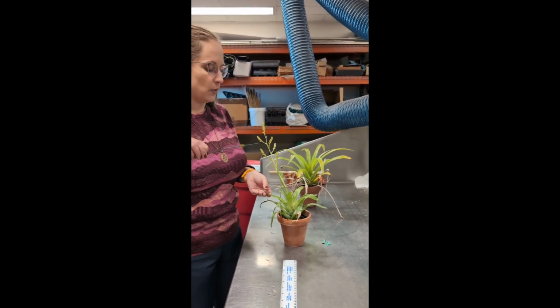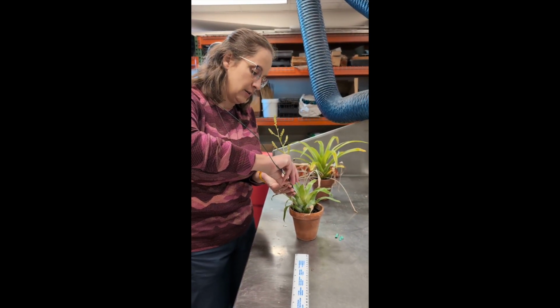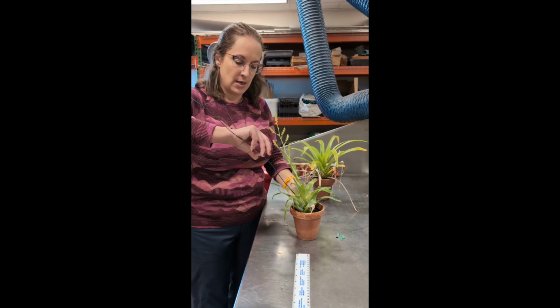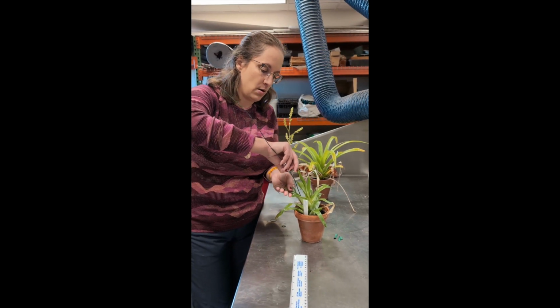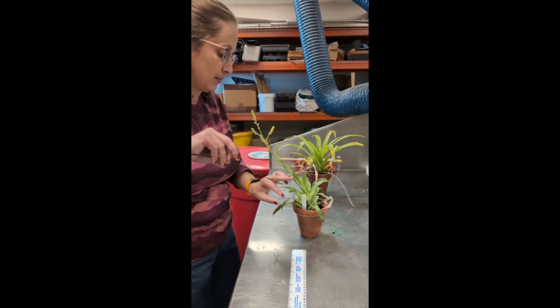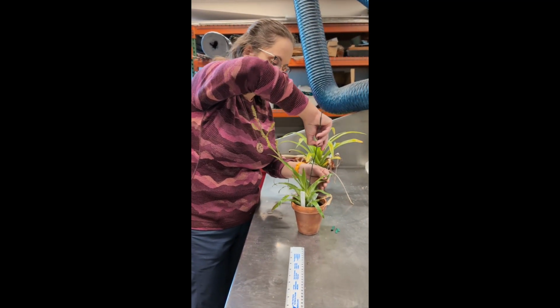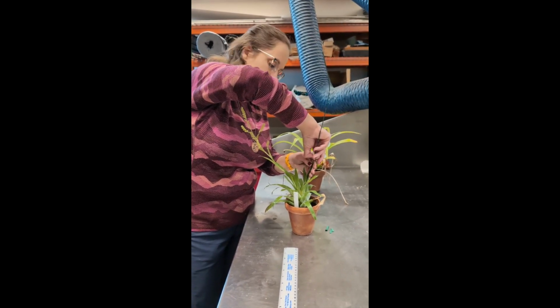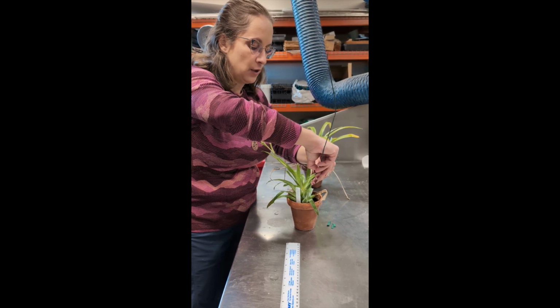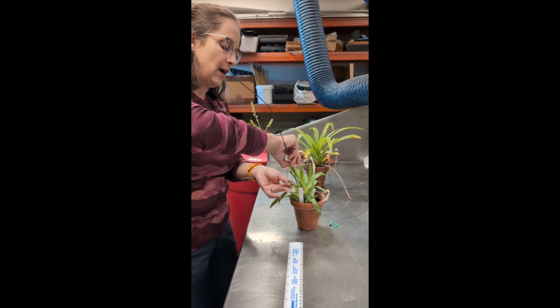at this time. So I want to see, are there any leaves that are longer? Just keeping that pinch, I come over here, and that's right at the same, so not longer. That one is not quite bigger. And yep, that's a little bit shorter than this one. Here I'm keeping an eye on it. Much shorter. And a little bit shorter. Yeah, sometimes they're really close. Once you feel like you've checked it out, you're like, okay, yep, that was the one.